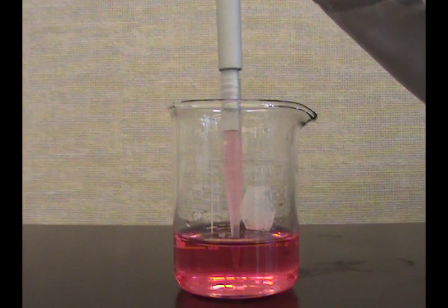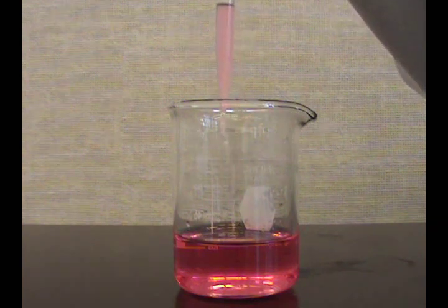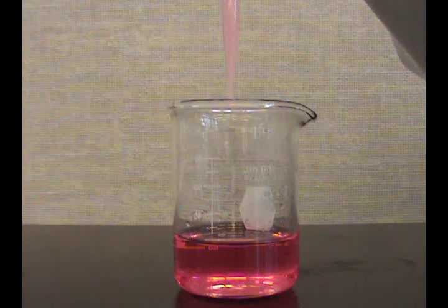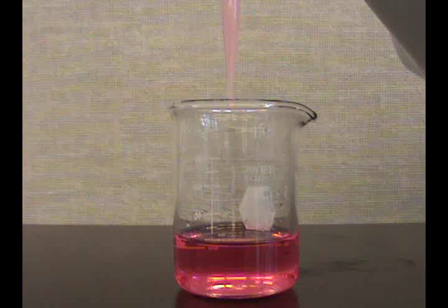Do not let the plunger snap up. Remove the tip from the sample. There should not be any droplets on the outside of the tip. If some liquid is on the outside, wipe with a kim wipe, making sure not to touch the tip opening, as this would absorb part of your sample.